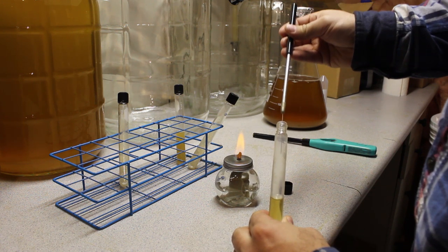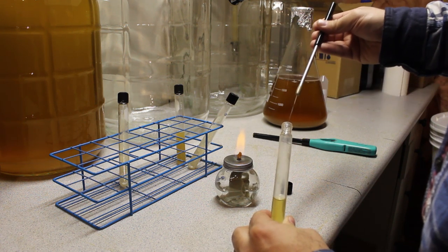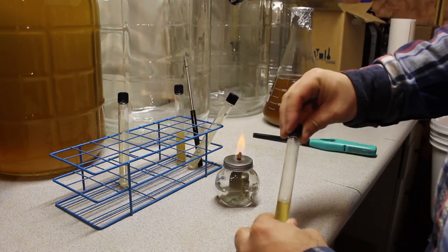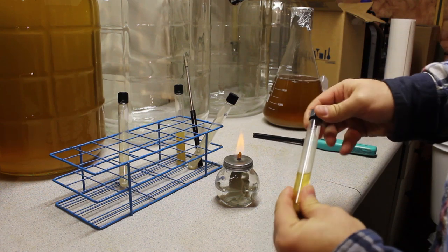And again just like with the agar plate, we're going to inoculate that into the tube. And I forgot to pre-shake this one to oxygenate, but that's all right because there's no reason why we just can't do that now.